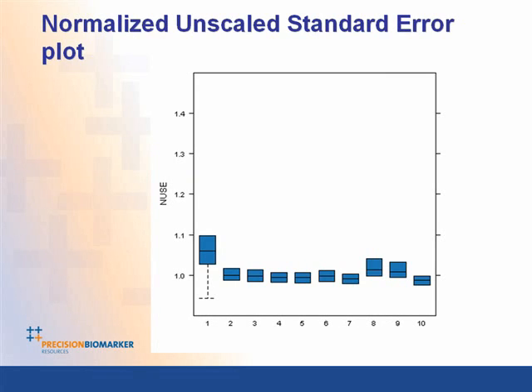Going a step beyond that is this so-called normalized unscaled standard error plot, which, similar to the previous plot, takes the standard error on the expression for each of these genes compared to the median, and looks at that across chips. Now, in this, the median should be centered around 1, and obviously a small error around that. And again, chip number 1 in this case has a much higher relative unscaled standard error, which suggests again that it may be an outlier.